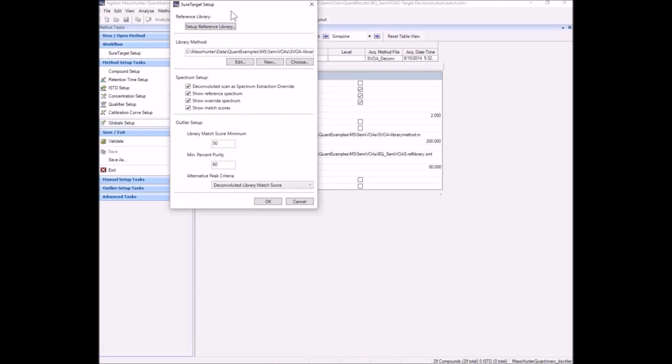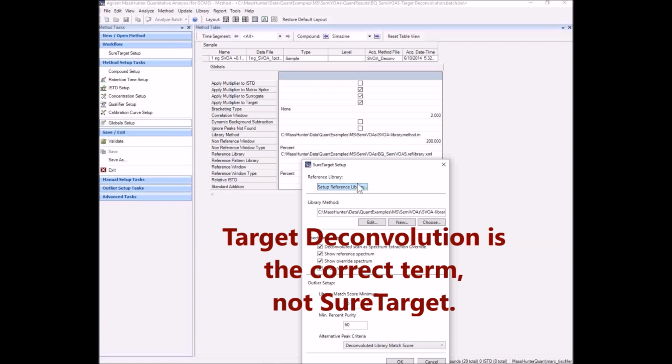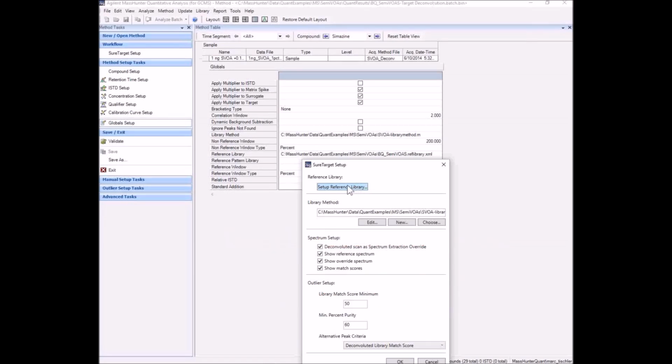So let me walk through setting up the method in the method editor. We'll go to the wizard and we'll show you the wizard. Now first let me point out, with alternative peak, we used a reference. That's a match. It's not a search, it's a match to give you a library match score. What we're going to do here is set it up for searching. That's the alternative hit, and we're going to use the NIST library. So we're going to set up a library method. Now the library method will override the reference library. We still respect the reference library if it's a standalone, but the library method rules.